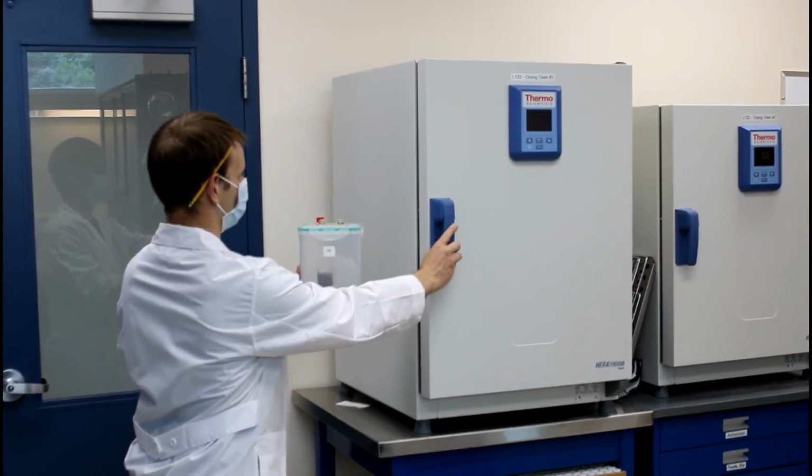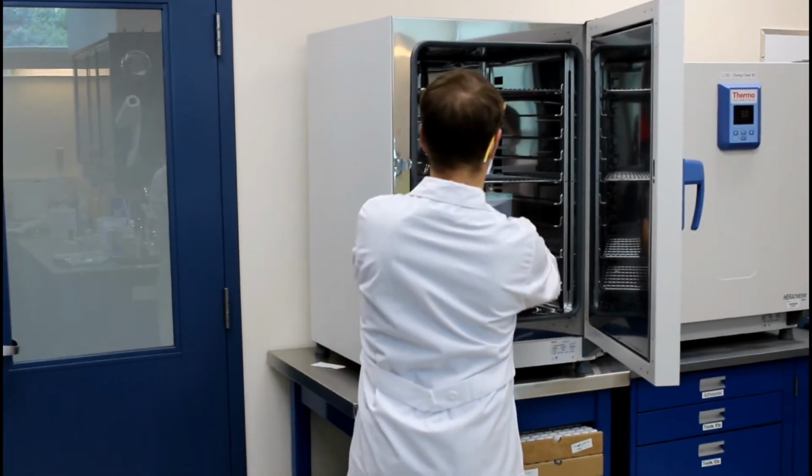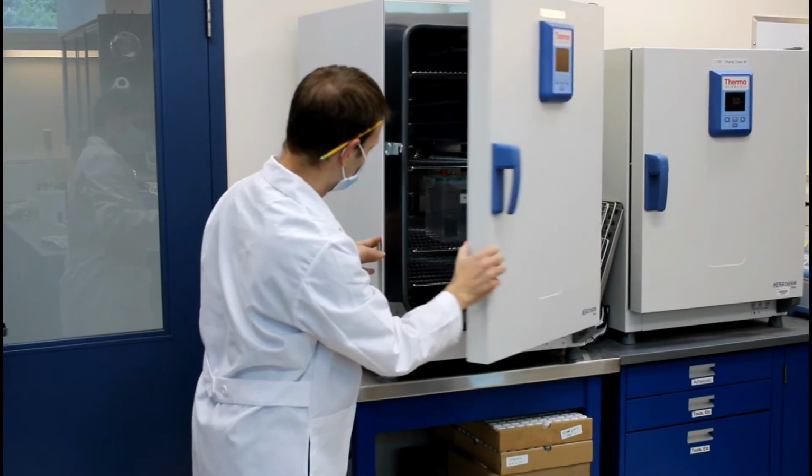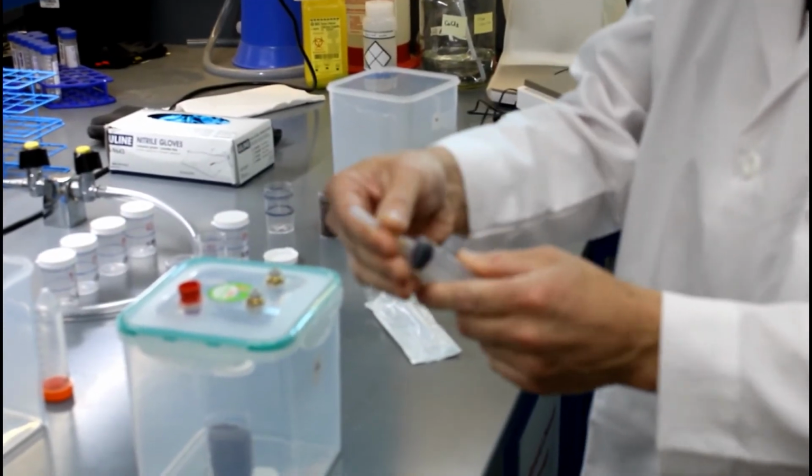The incubation can be done at different temperatures, and 25 degrees is generally considered as a standard. The gas sample can be collected at different time intervals, but time 0, 24 hours, 48 hours, and 72 hours are generally considered standard to produce the regression lines.